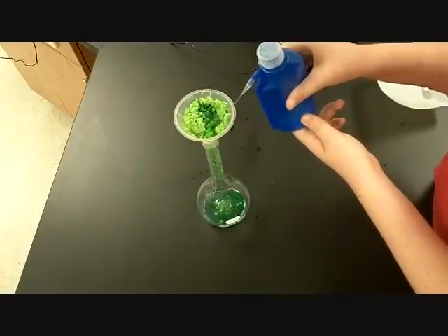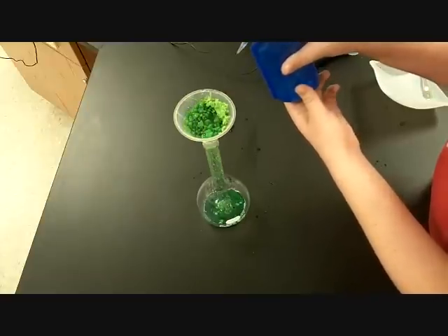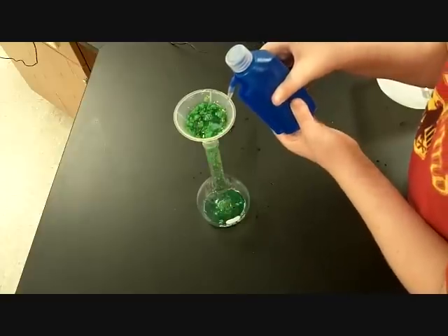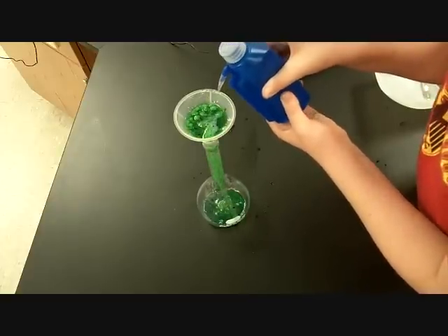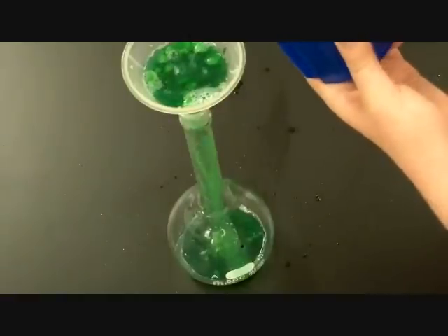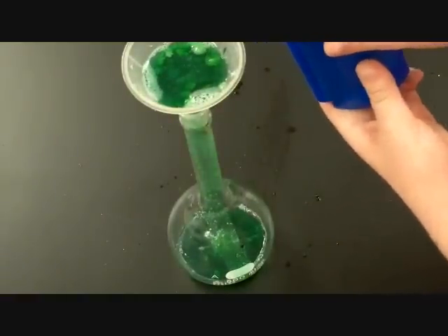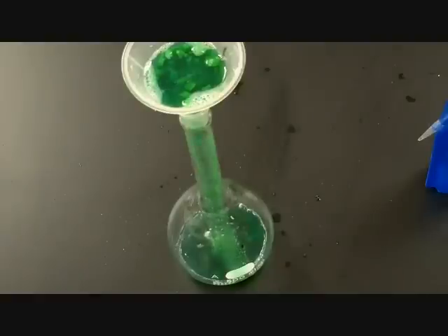Now, somebody might be saying, wait a minute, you're adding water already. Remember that the total volume that we need to add to this solution needs to be 500 milliliters. So it's okay if we're adding some water right now to help get the ions in the volumetric flask. If you look at it closely, I'll try to zoom in here, it kind of looks like some of the granules. Now slow down, bud. Let some of that water go down. Relax. As you notice, we're not even getting close to that 500 mil mark yet.